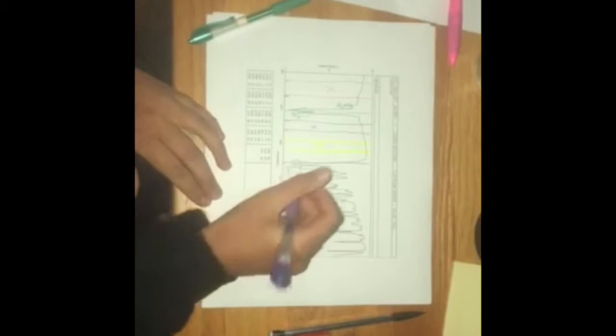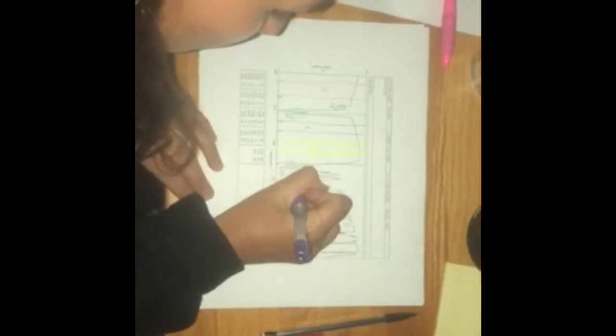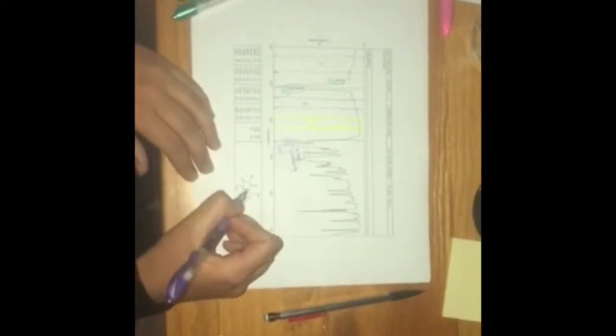And then this final region is called the fingerprint region, and we have this signal right here, which means that there's a C double bond O is what these two dips mean. And then there's a signal here, which is right about the 1600 mark, and that could mean alkene stretching, which makes sense because we have some double bonds here that would explain that. And then also with this C double bond O, we have a lot of those as well.